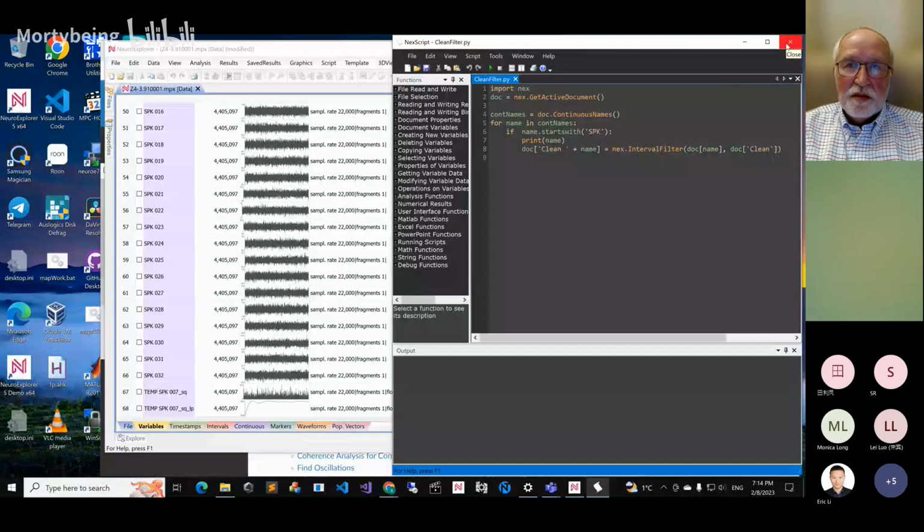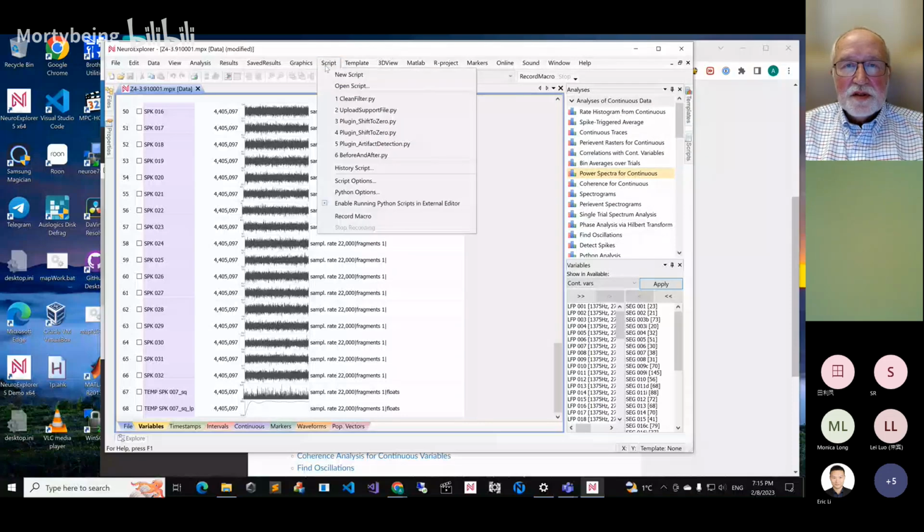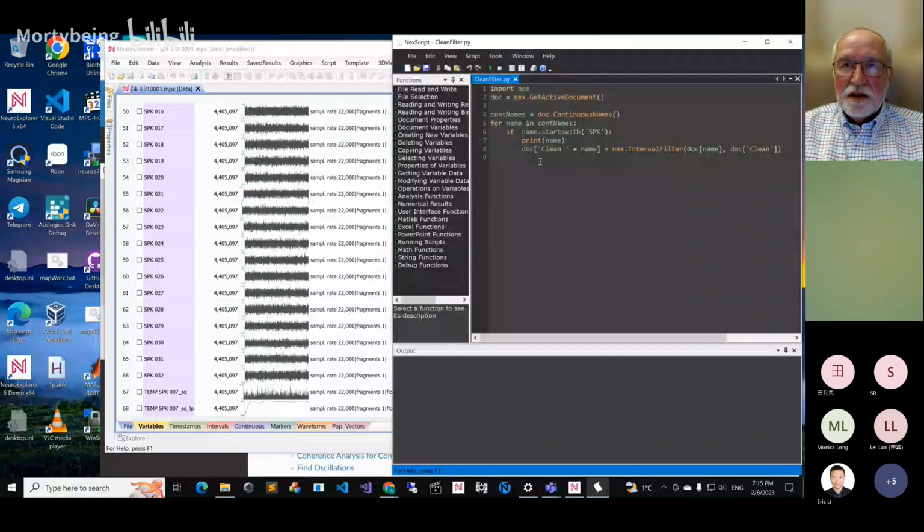If you need this, I can make this script for you, and then just to make sure that you understand how to run scripts, you will go again to download support files, then script, open the script that I just sent you, and then here you select script, start, and it will create all these variables with clean before the name. So the idea is that you take the name and generate a new name for the new channel with the prefix clean plus name, and then you do something with your original channel. That's the idea of the scripts.